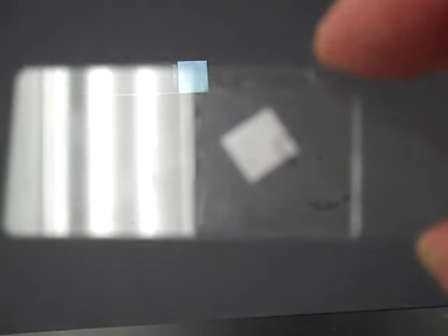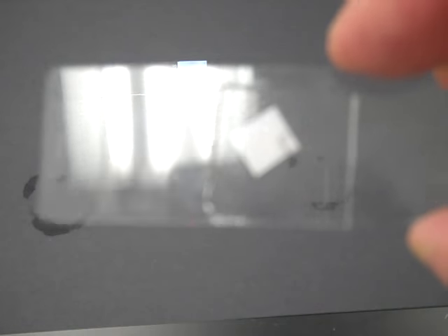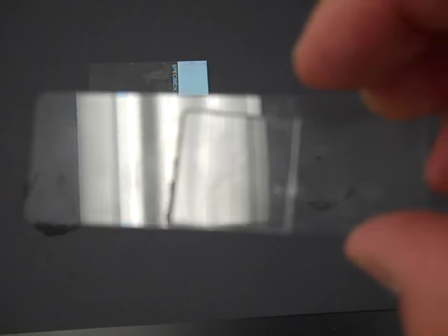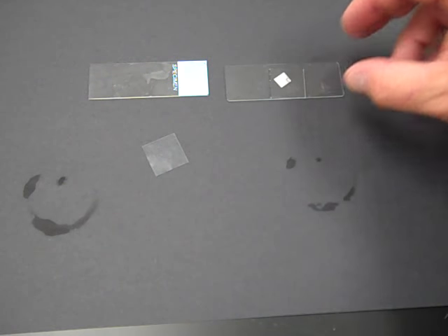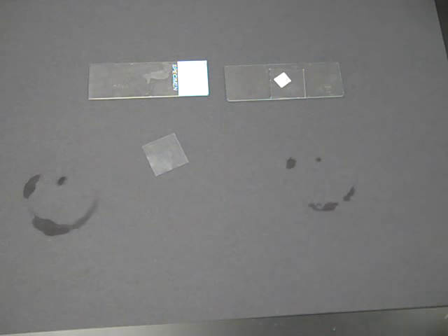Your goal is to try not to get any bubbles underneath, because bubbles are really hard to see through in a microscope and mess you up when you're trying to look for something, especially if you're looking for little cells or different things like that.